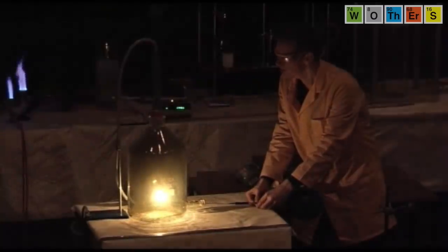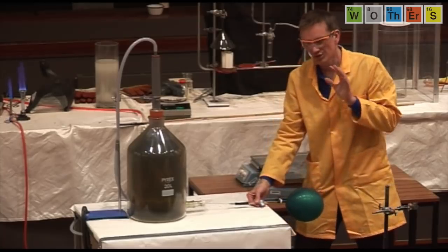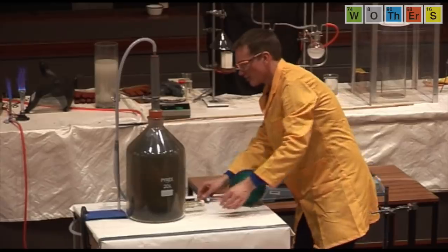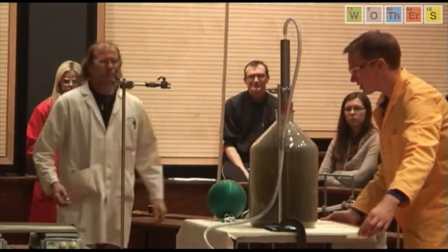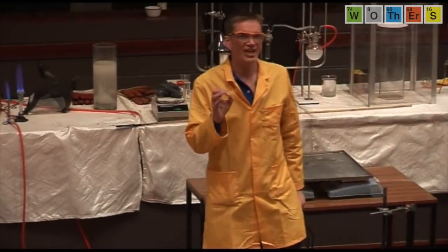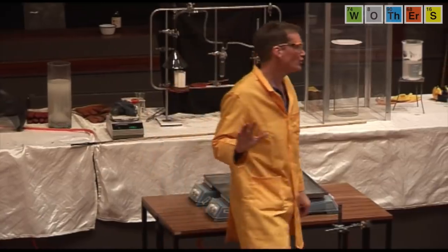Can we have the lights up, please? So you can see all the carbon that's forming here because the reaction isn't really complete. So it's a very smoky reaction, but nonetheless, this is a reaction involving no oxygen at all. Okay, if we wheel this one away, please, and we'll swap it. So that was a hydrocarbon spontaneously burning in chlorine. Okay, no oxygen at all.